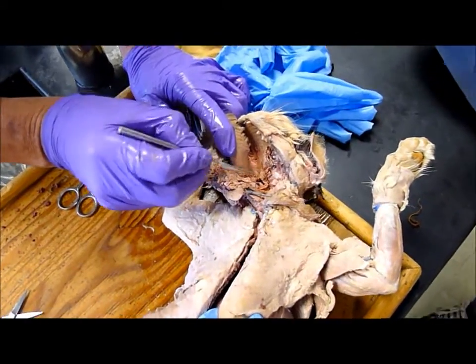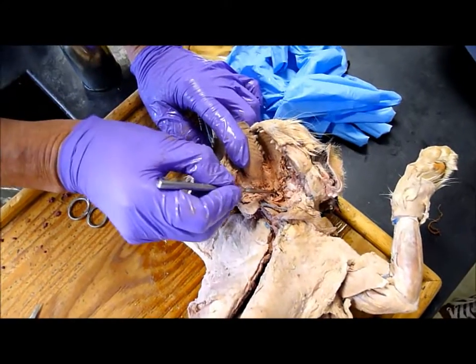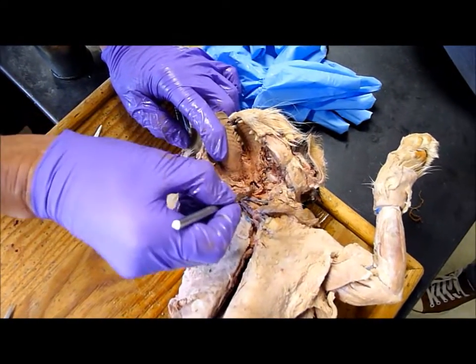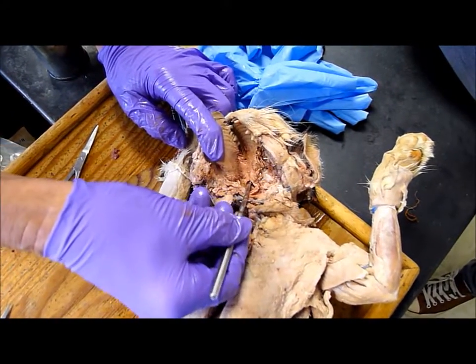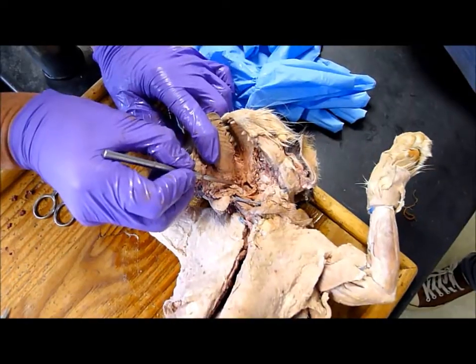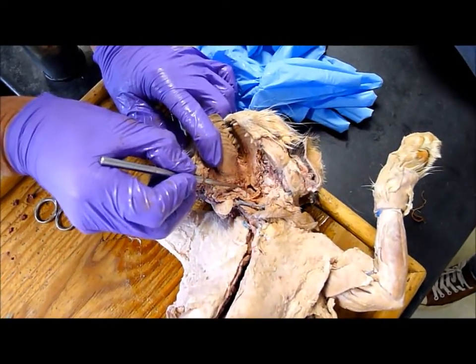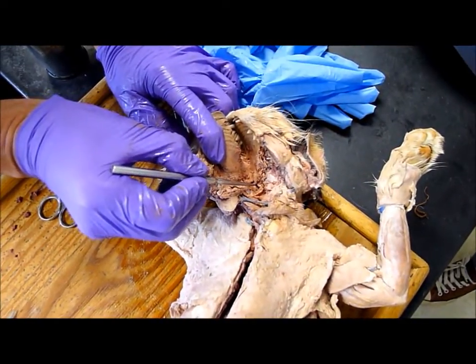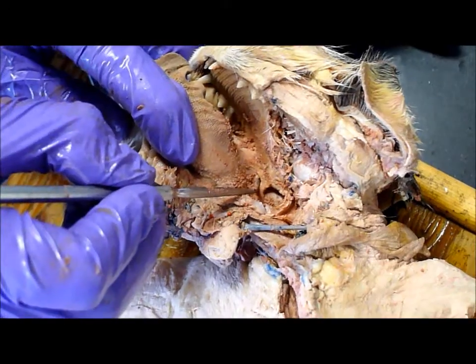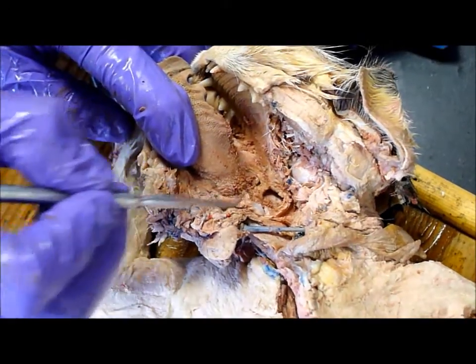This is all pharynx, all this region. This is the choana, because there's the nasal cavity. And then see that little nub there? That's a tonsil, so that's the tonsil right there.